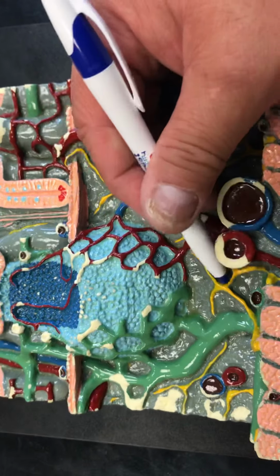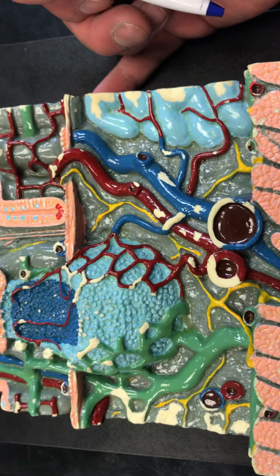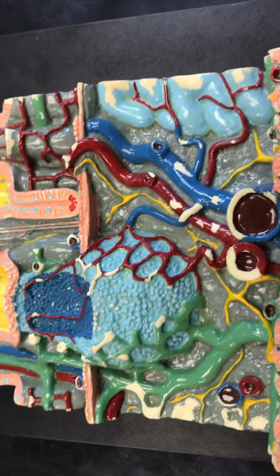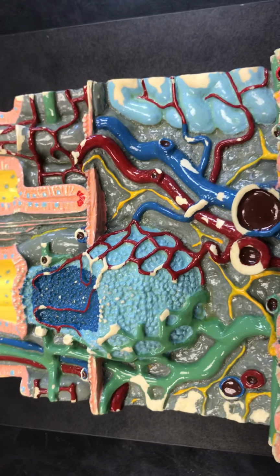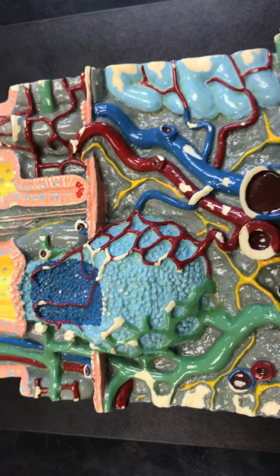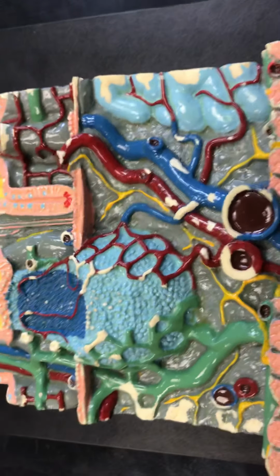This is our submucosal plexus that allows us to have increased secretion of mucus, so then we can have protection when new acidic chyme comes in. It allows us that reflex where all it takes is food to enter that region for us to actually produce that mucus. You don't require a functional brain, a vagus nerve, or anything like that.